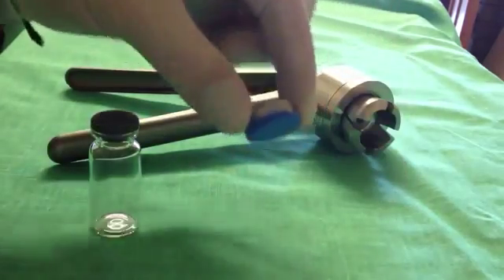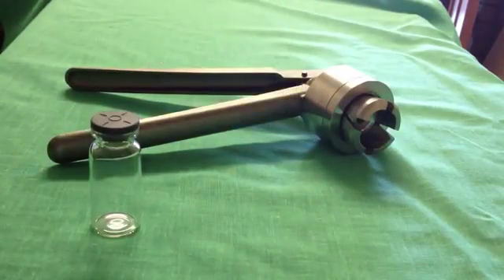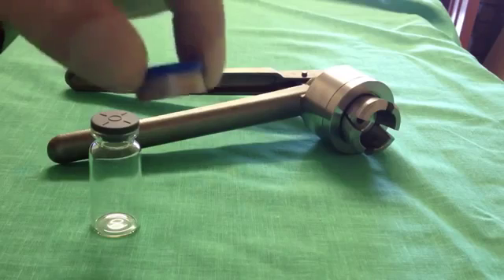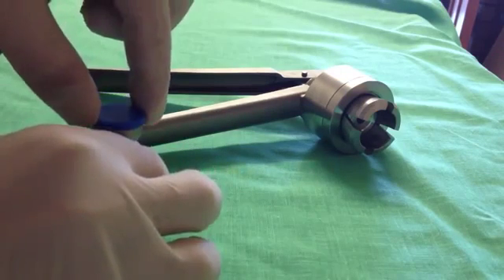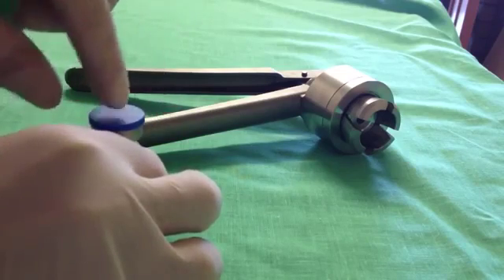Most importantly, get the actual cap and try not to bend any of the edges, and just slowly put it over until everything is level.